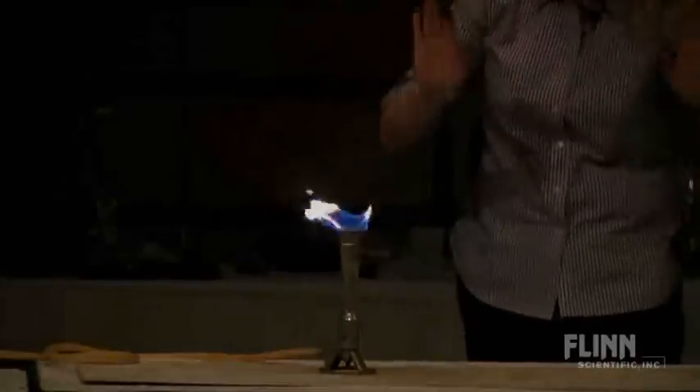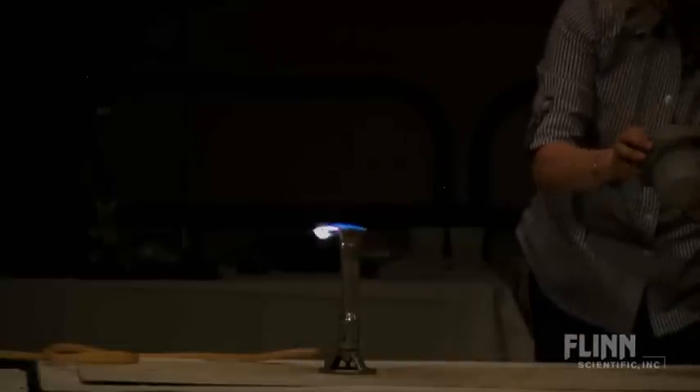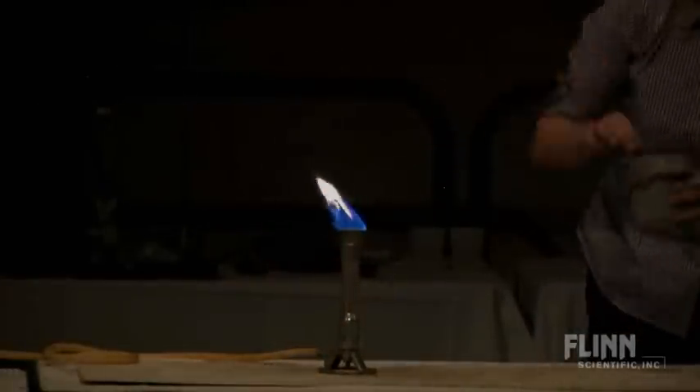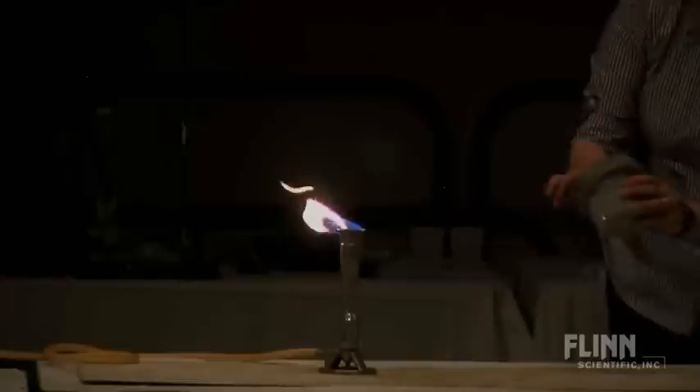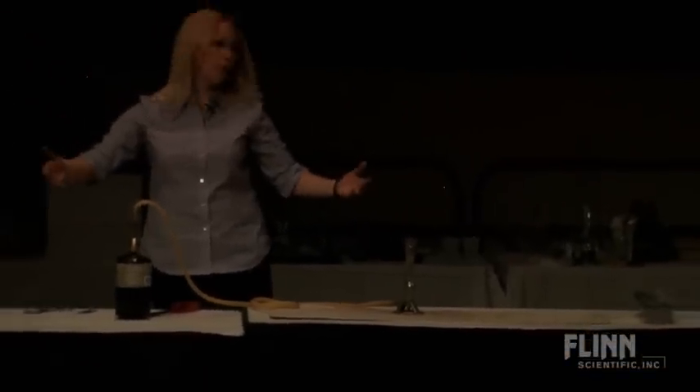Now here's where you've got to be careful. Don't ever use powdered magnesium — you've got to use 20 to 30 mesh. So I've got 20 to 30 mesh here. Perfect timing! Why is it so much faster? Incredibly a lot faster — because it's much more reactive.